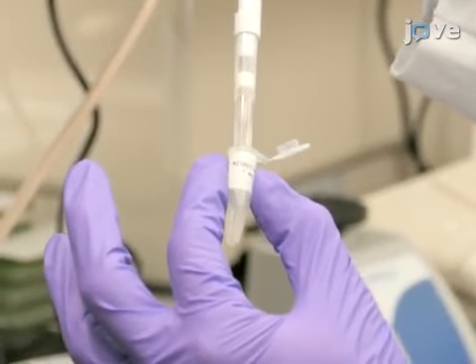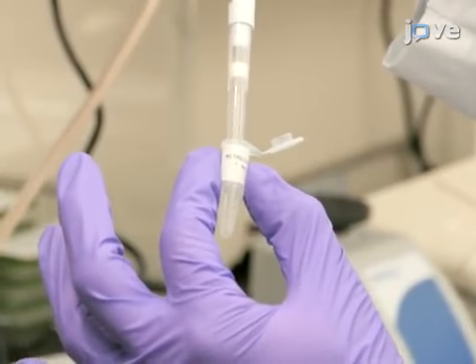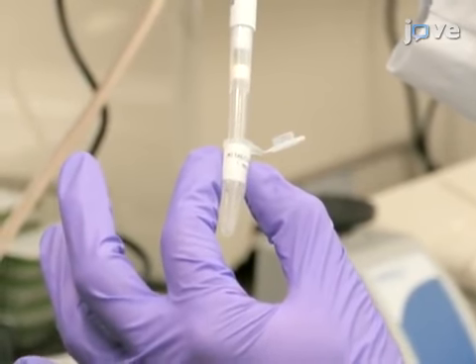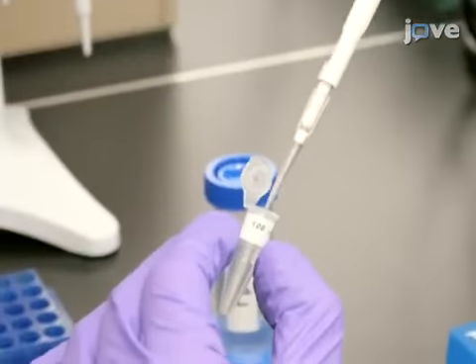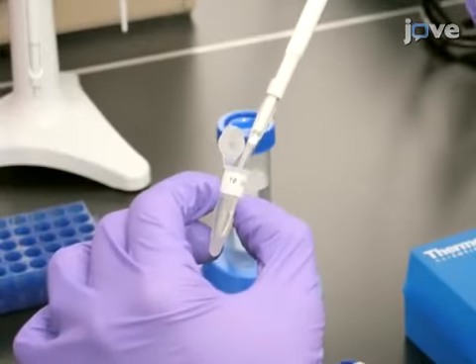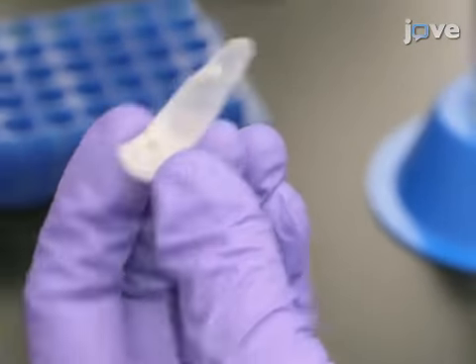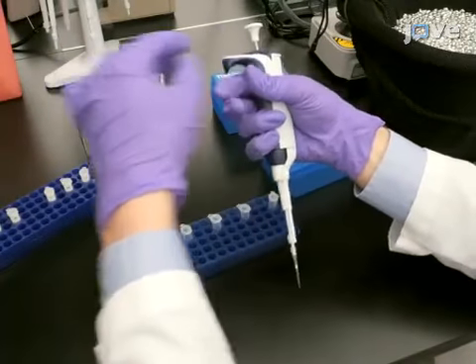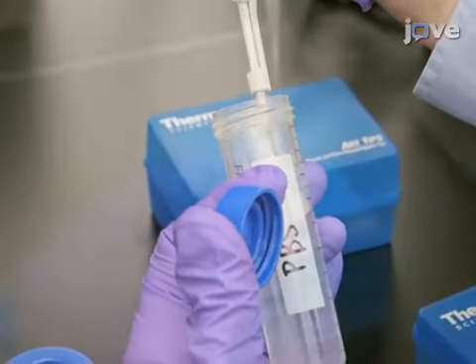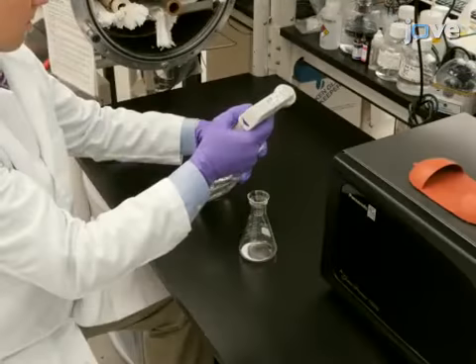Prior to starting the microslide diffusion assay, the concentration of the antimicrobial enzyme to be evaluated should be determined using a BCA protein assay kit according to the manufacturer's protocol. Perform a serial dilution of the antimicrobial enzyme using PBS as a reaction buffer. Dispense the protein into individual microfuge tubes and adjust volumes to 20 microliters using PBS.